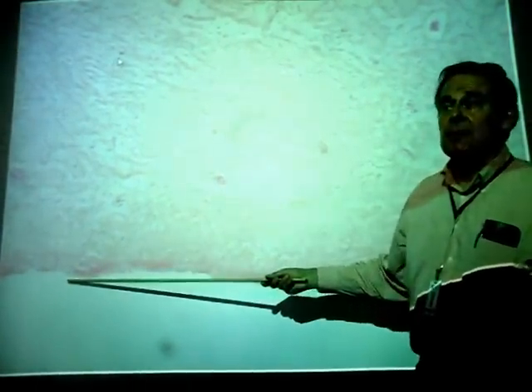And then, right on the very outside, you see this thin rim right here? This is perimetrium. Simple squamous epithelium, a little bit of loose connective tissue, but a very thin layer. And it's synonymous with the visceral peritoneum. Remember, it covers many of the organ surfaces in the abdominal pelvic cavity. Peritoneum, pleura, and other serous membranes. The parietal peritoneum would line much of the abdominal pelvic cavity wall.